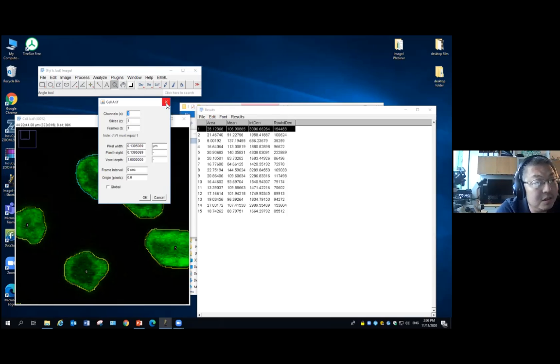But sometimes you will ask, how does ImageJ know what the pixel scale of this image is? Okay? Because by far, almost every single modern imaging instrument will save this information with the image itself. It's saved into something they call the metadata. And ImageJ normally can read the metadata very well, as long as you keep it in the raw data format.